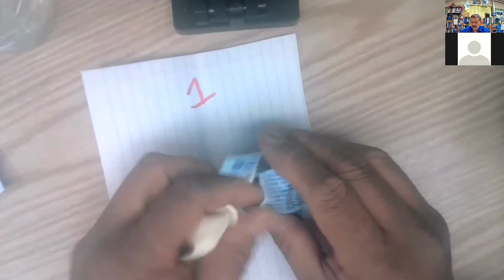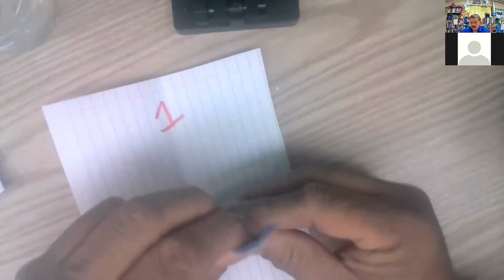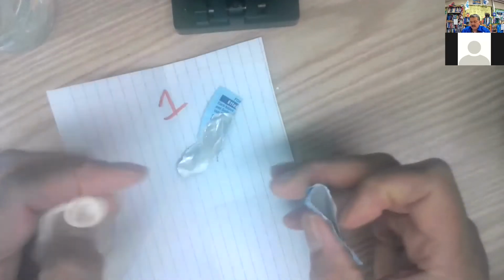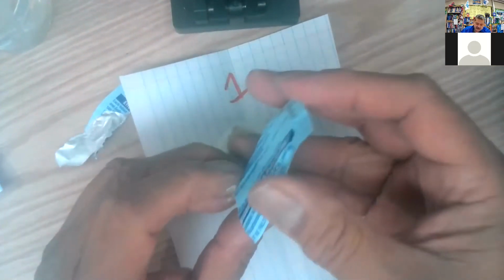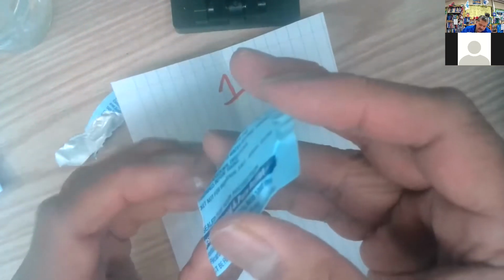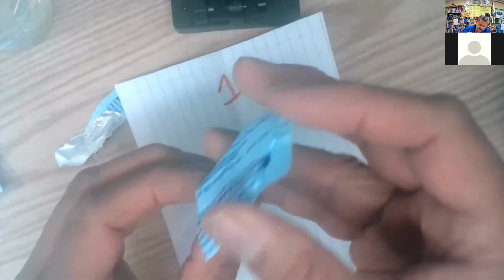And so I'm going to take the powder and pour that in successfully. If I miss, it will go on the paper, and I'll pour the rest off of the paper. So let's try. Hey, that's working pretty well. Okay, so just pouring that in there like that. I think I got most of it in there already.